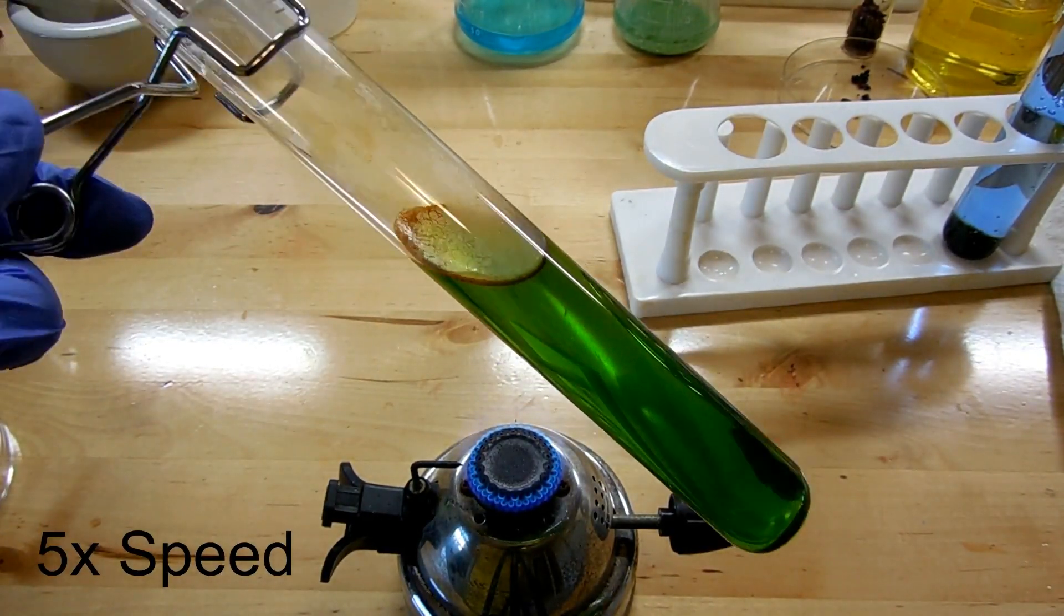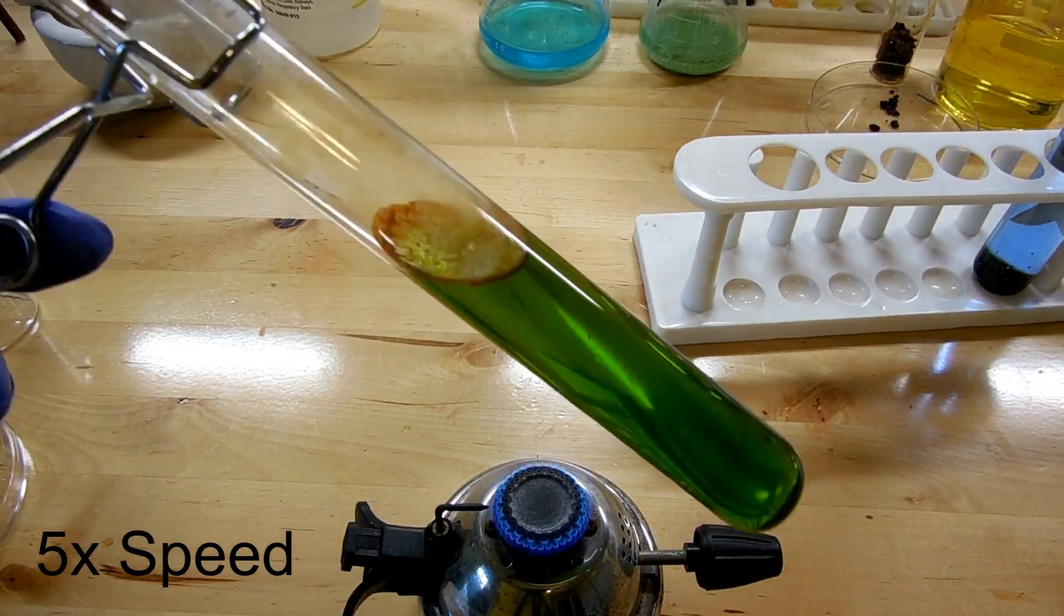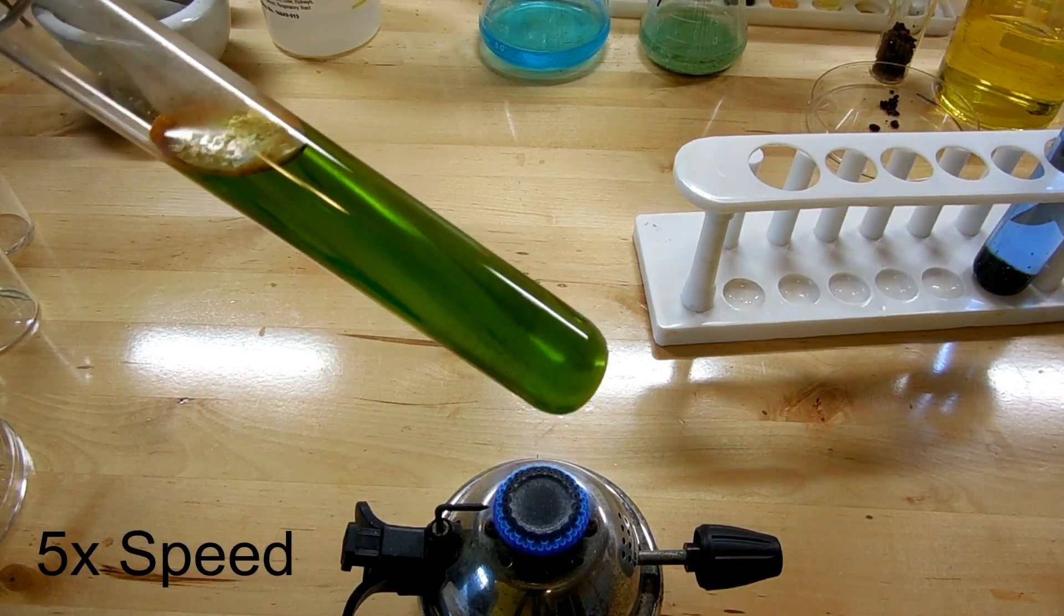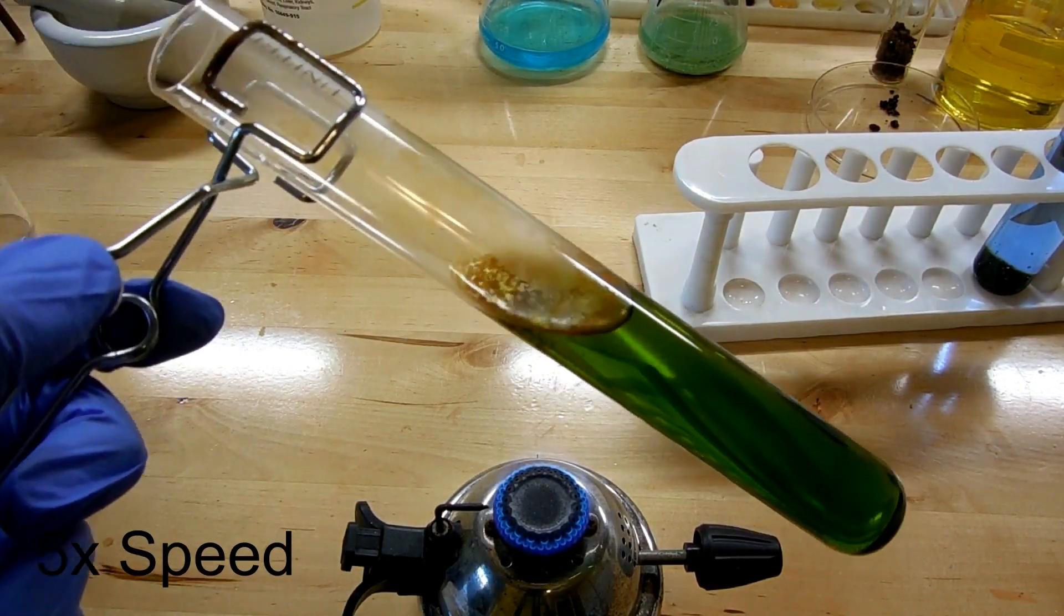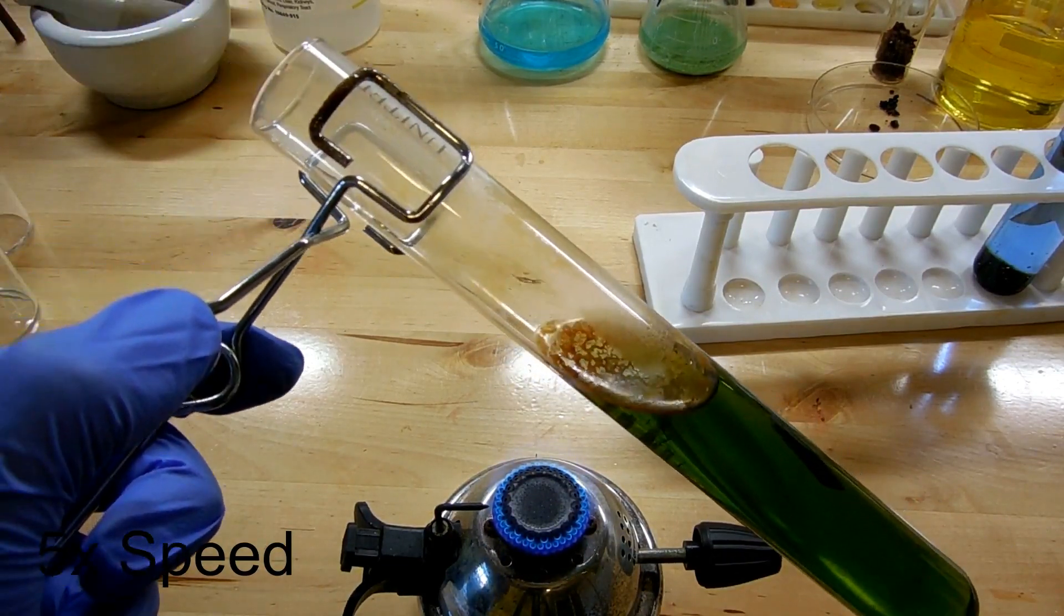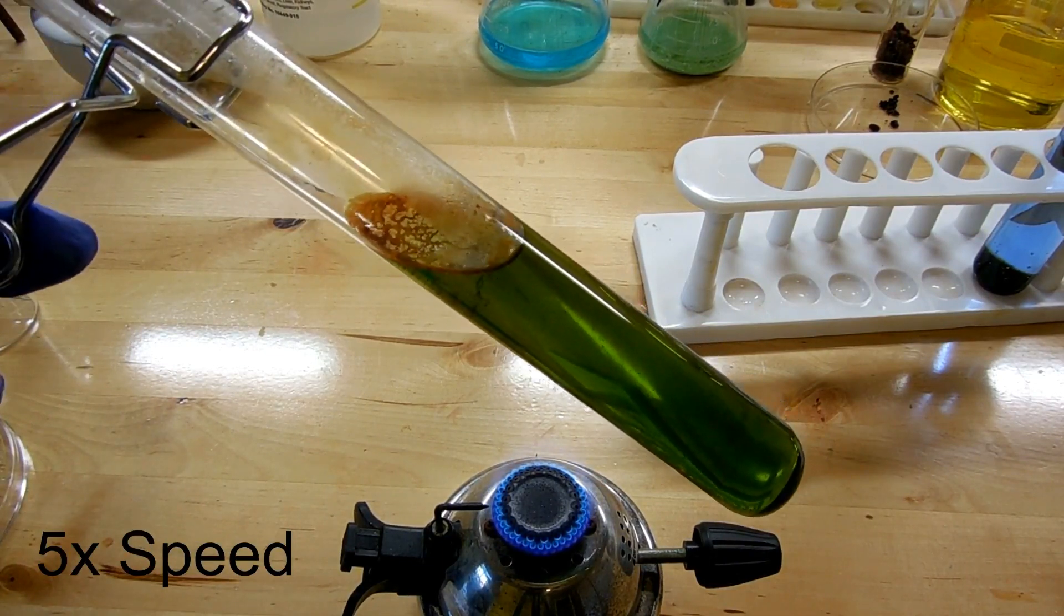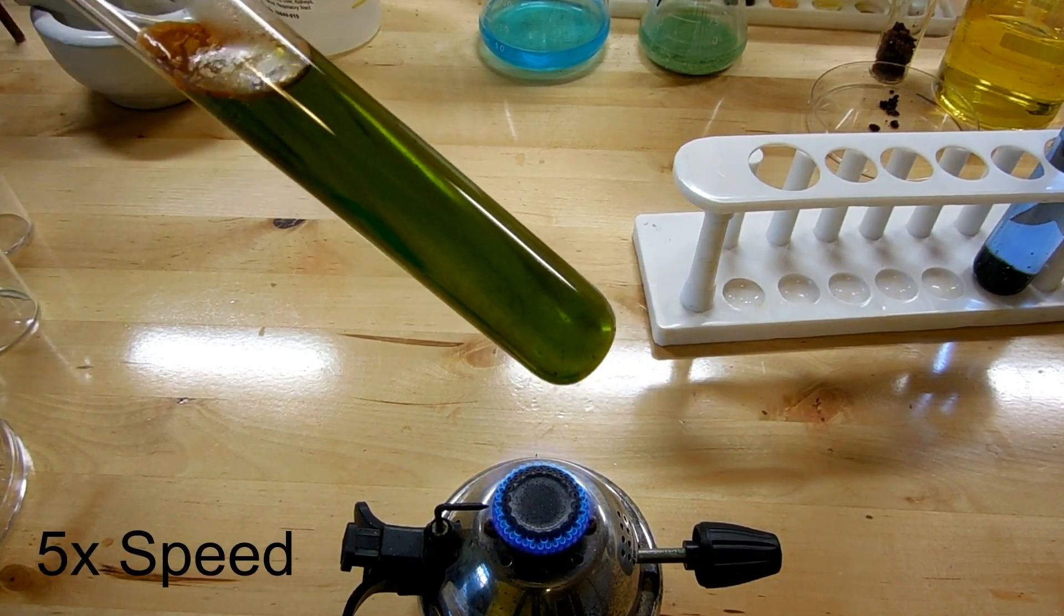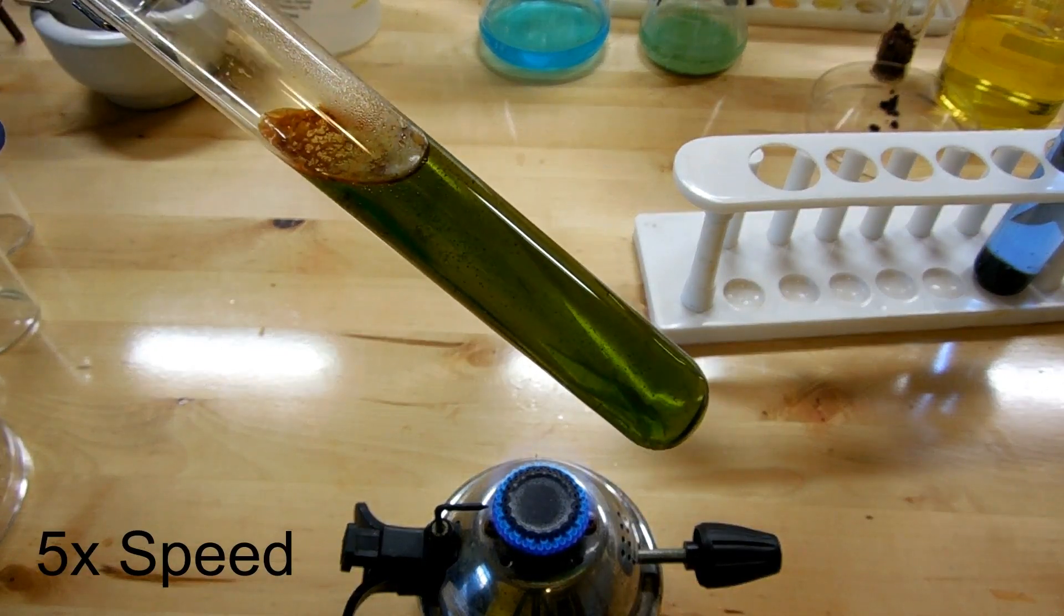You can see at the top of the liquid right now we're getting a little bit of a color change to happen. Looks like there's a crust of some material forming. There you go, you can see it now it's really darkened a lot.